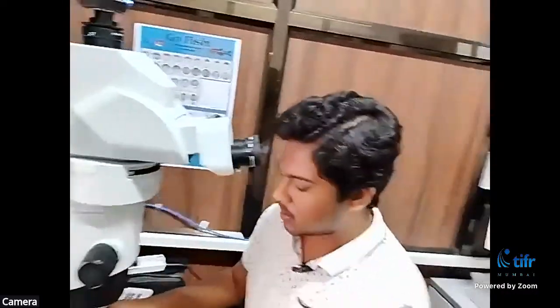Yeah, so now you have seen these fishes, and they are transparent. But if we want to focus or see a tissue at better contrast, how do we do this? To view the tissues of interest at a better contrast, we use certain staining techniques.